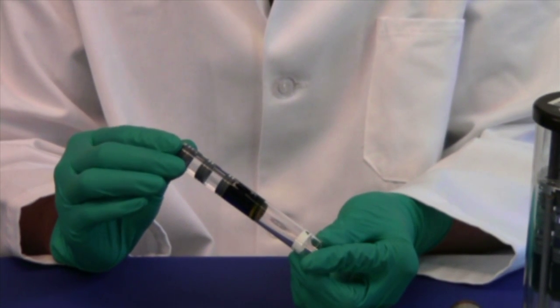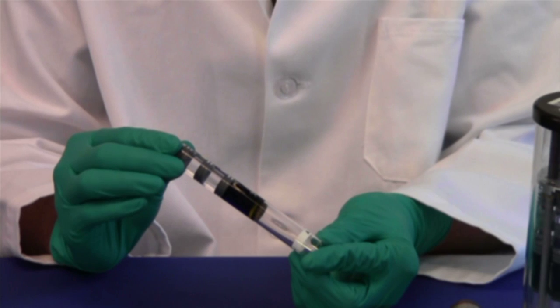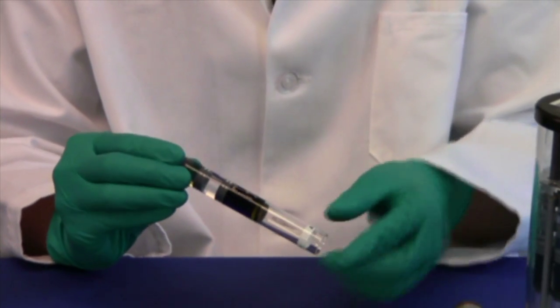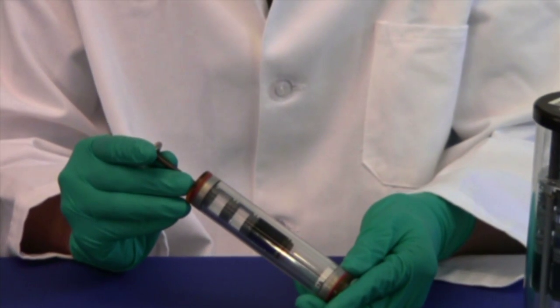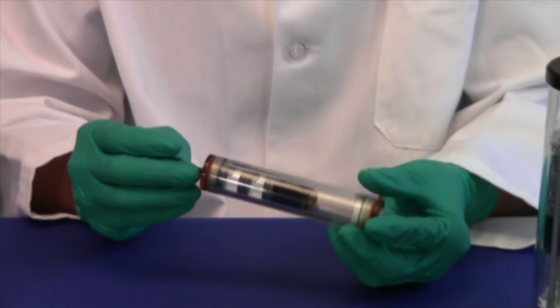If your experiment requires only one tube to be activated, or multiple but at different times, you can use a sheath like this. Then, on orbit, the astronauts would activate it like this.